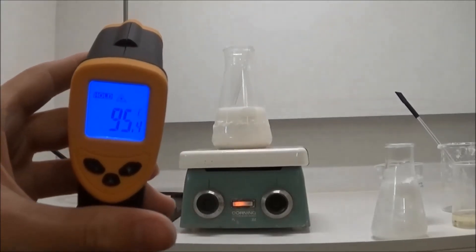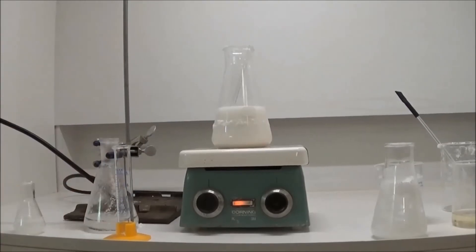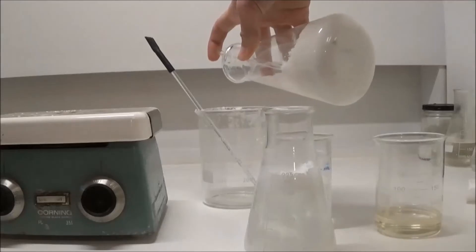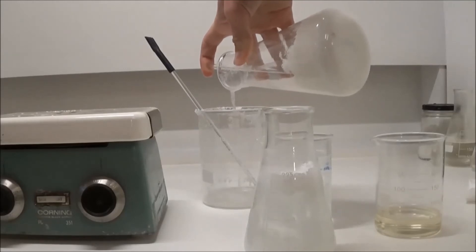Upon reaching 95 degrees, almost everything had dissolved, and I let it cool. Crystals precipitated as it cooled. The liquid was carefully poured off of these crystals.